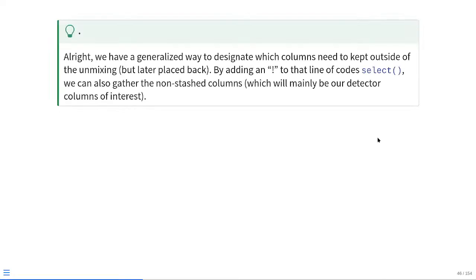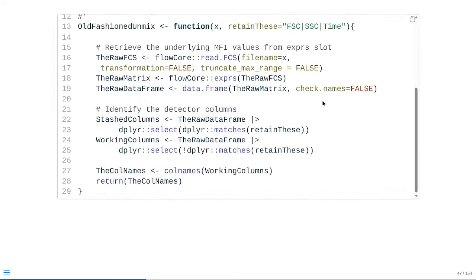Alright, we now have a generalized way to designate which columns need to be kept outside of the unmixing process. And at the same time, if we take that existing line of code that we're using to select these that are being excluded, if we add a little exclamation point inside, we can basically flip the argument and end up grabbing all the columns that we actually want to keep, i.e. all those detector columns. So, what's that going to look like in practice?